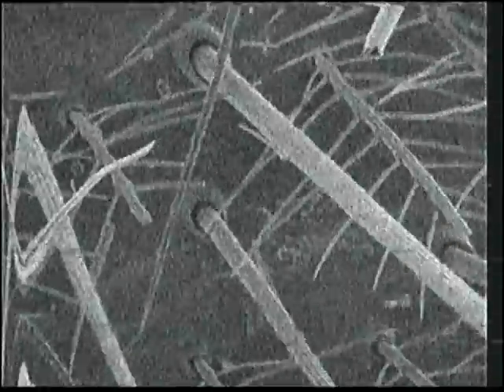Kind of cool, a lot of structure there in insects. Hairs coming off of hairs, well, those are probably just peeling off of the hair so that it improves their sensitivity or how well they can grab things. I would just guess, just guessing, not a biologist.